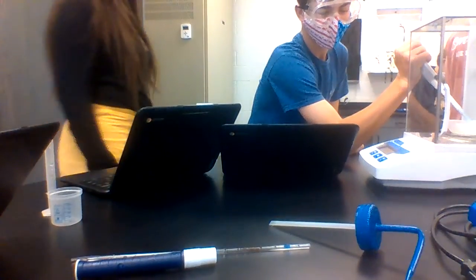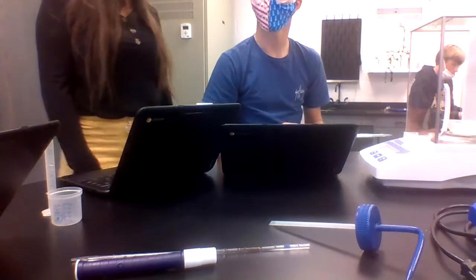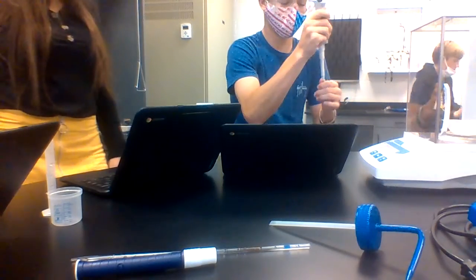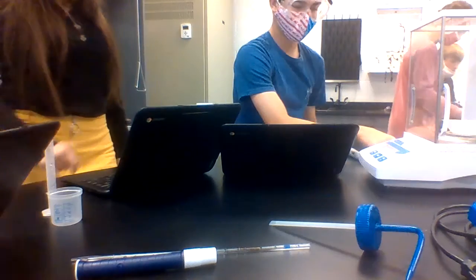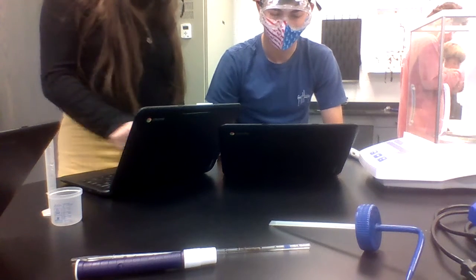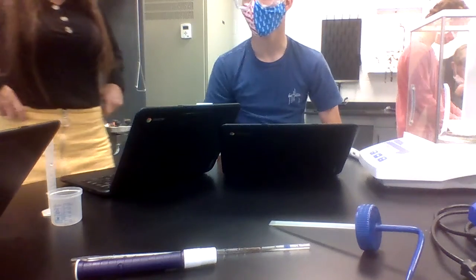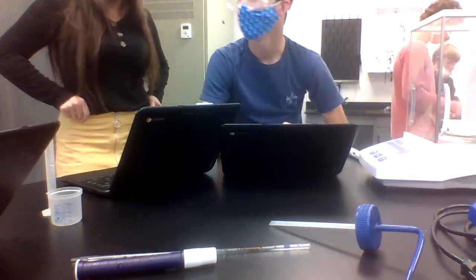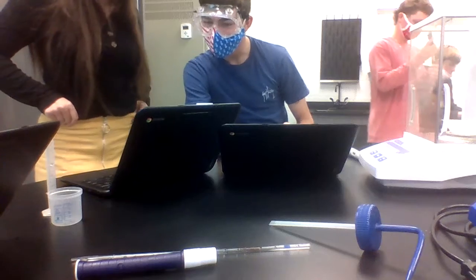Dude, we're barely getting over 2. Oh. What was it? Cole. Well, you have more decimal places. You guys are now getting a more accurate answer. It's not just going to be one. Oh my gosh, I've been recording all of these on the top. What? No? So did you?